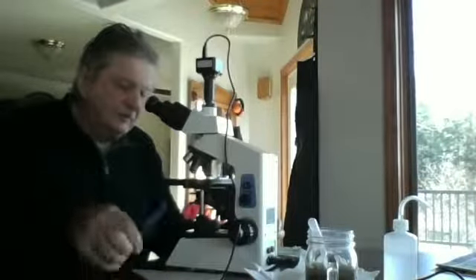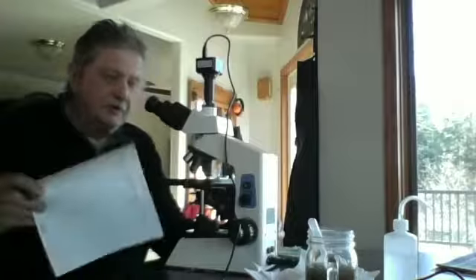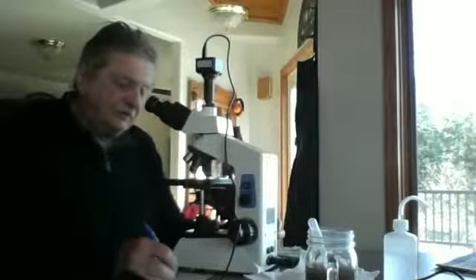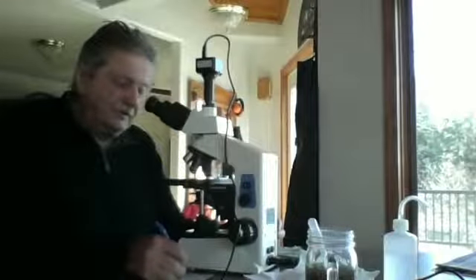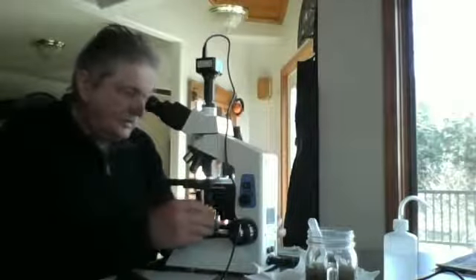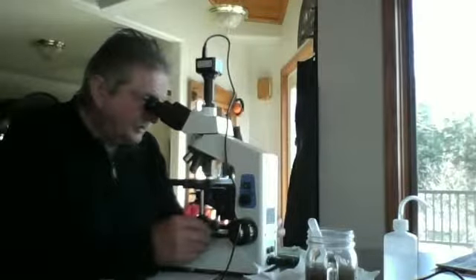I don't see any amoebas. So on my recording sheet, I record one flagellate, 0 fungi, 0 actinobacteria on my main assessment. And then I will move laterally 1 field of view roughly.